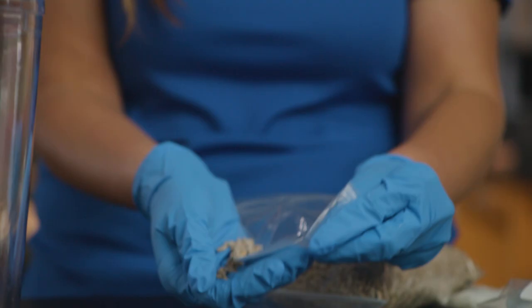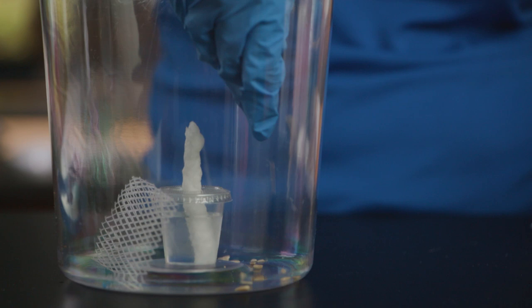Place the food near the bottom of the climbing net or towel. Food should be replaced when it appears shrunken or shriveled. Milkweed bugs will not consume the entire seed. Do not allow the food to become moldy.